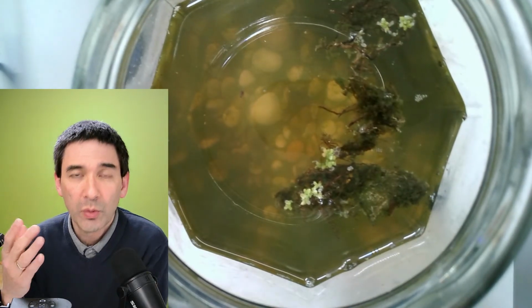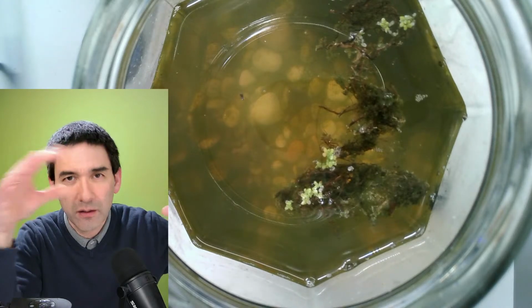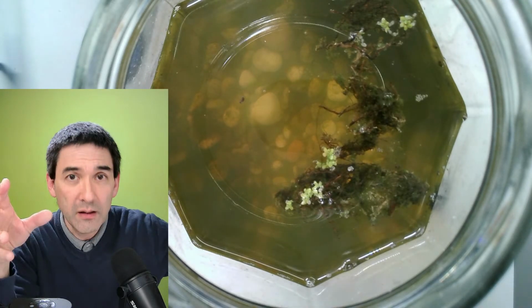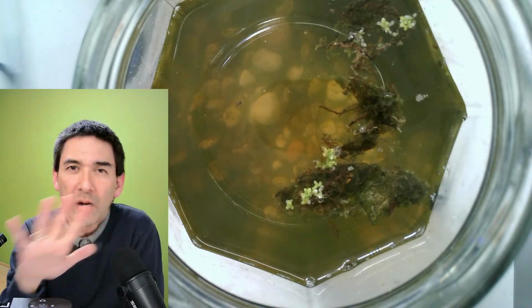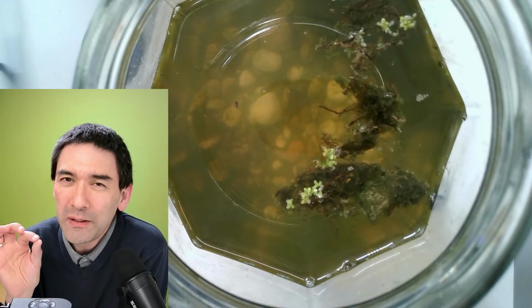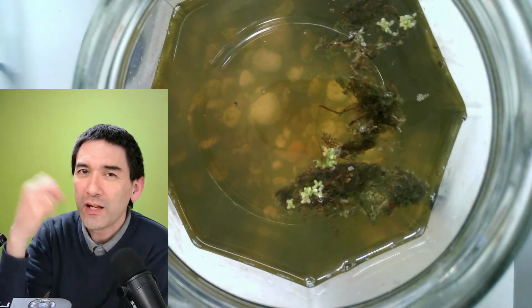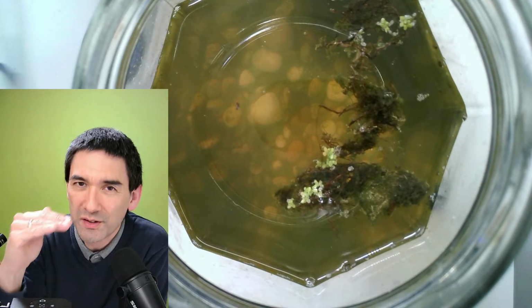Okay, so what you do is you basically stitch images together and you get a gigantic picture, right? And then you just zoom in and explore around, and you can add labels and so on. All of this stuff already exists. However, and that's something that I have not seen yet, it would be nice if you had not only a two-dimensional, but also a three-dimensional one. That means it allows you to also virtually focus.